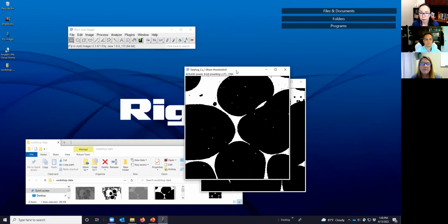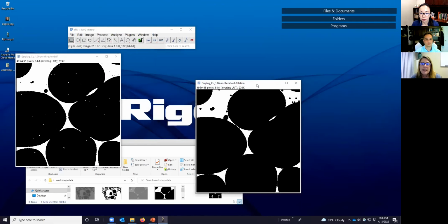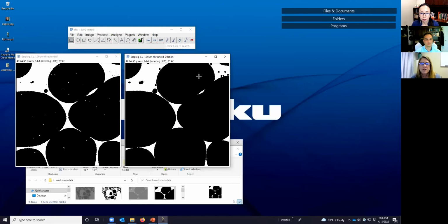Here we have our original image, and here we have the result of dilation, where these islands that are false values are now larger. Inside of the voids, our holes are missing, but unfortunately, we've created connections between voids that don't actually exist.